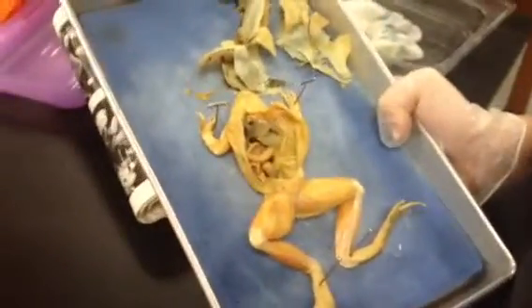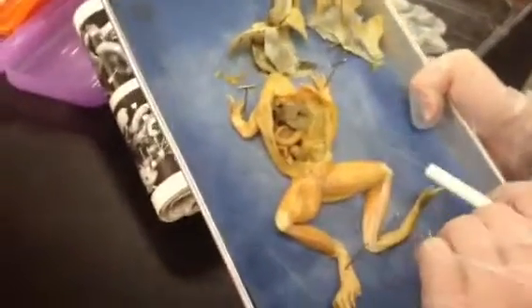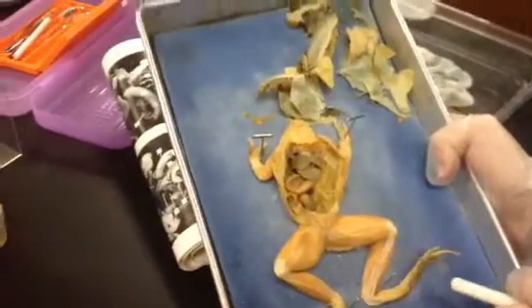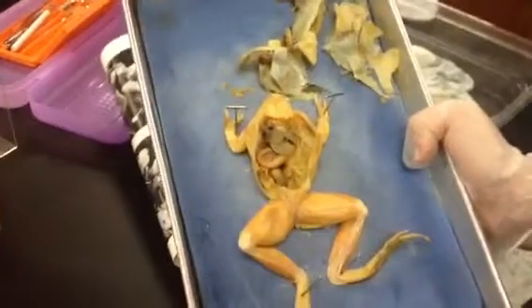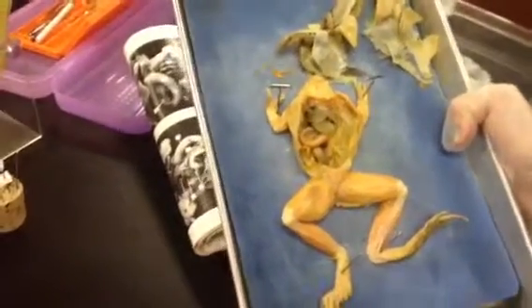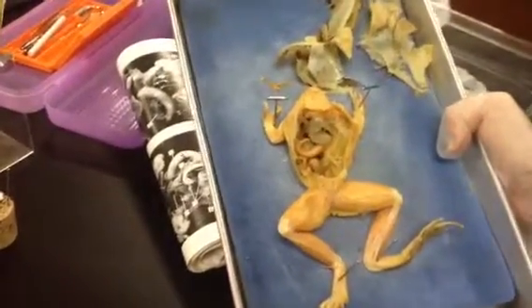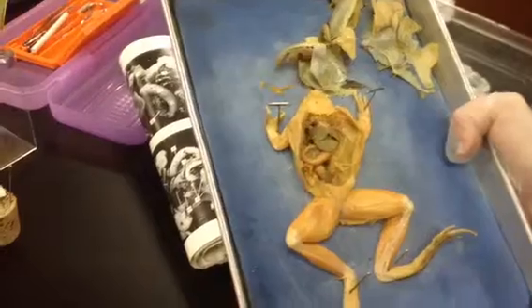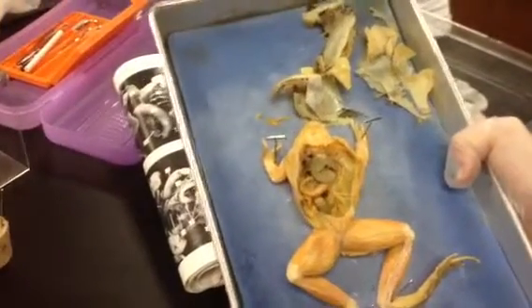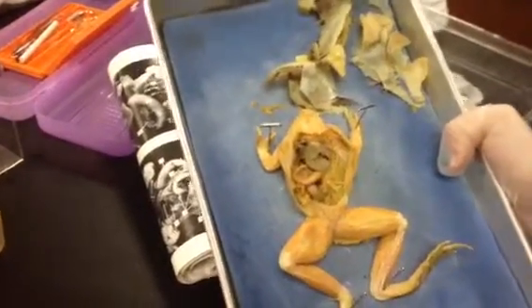Hi, this is Becca and Casey here with Dexter, who is a male frog that is approximately 10 centimeters long. Today is frog dissection day 4 and 5, and we are going to discuss the thoracic, abdominal, and urogenital cavity structures of the frog.